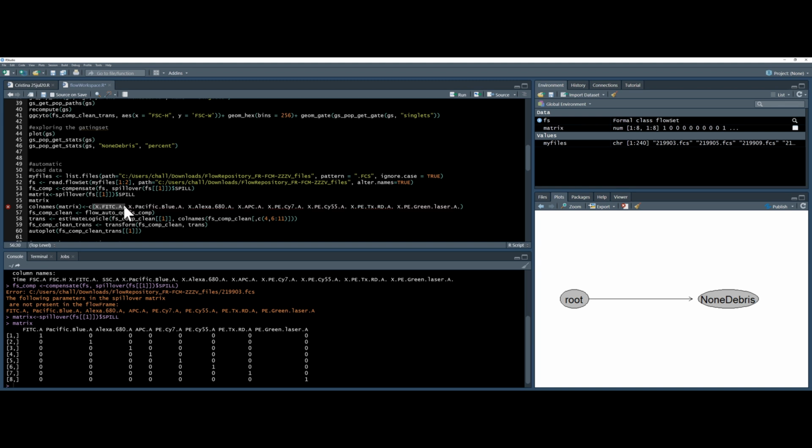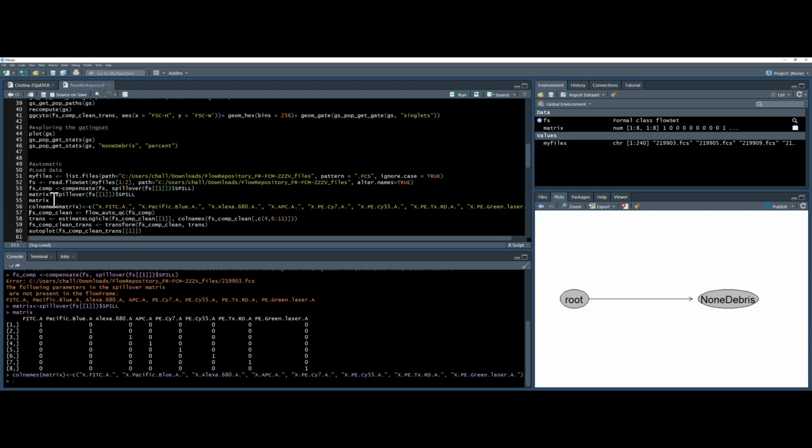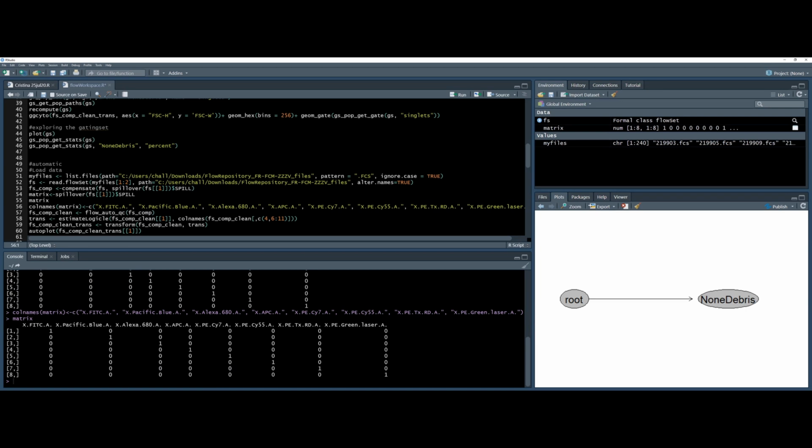I'm going to speed up the video to make it more understandable for you. Okay, as you can see, that took a bit longer than it should have because I'm using a giant cursor, which makes it very hard to highlight the right things. But I'll use this column names. Oops, I can see an error there. There we go. Press Control Enter. And if I look at the matrix again, I've got new headers on my matrix, and that works.